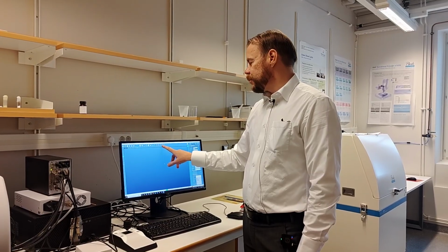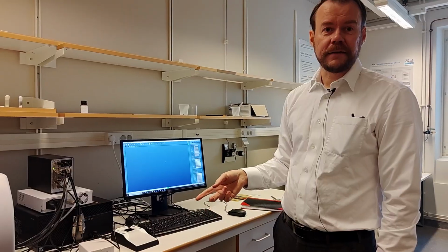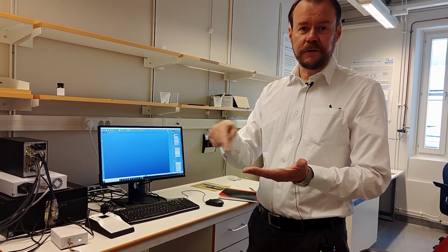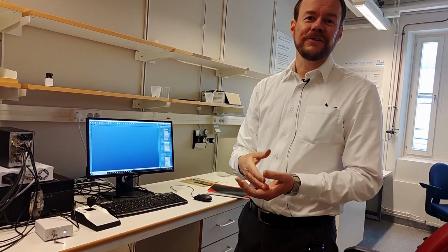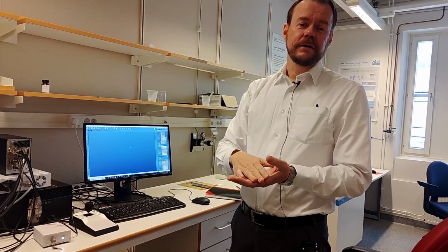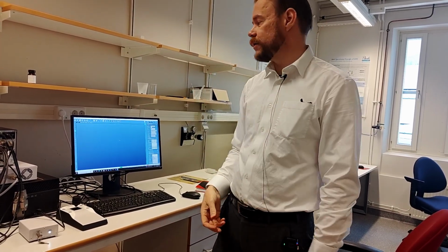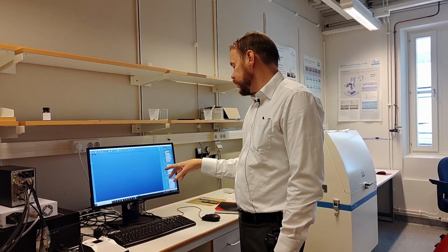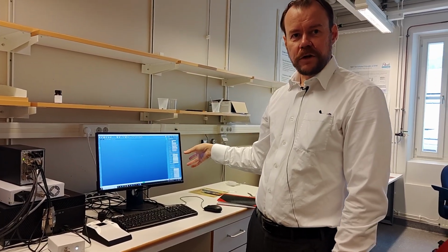And then there is this record button with that kind of matrix, and that is when you do mappings. So a mapping is when you want to get Raman spectra as a function of x and y position. You can take like 10 by 10 points, or as many points as you want. And you can also do a depth profile and make a three-dimensional volume if you want to. So you can measure as a function of depth, as a function of x and y. Then you get that kind of 3D matrix. But in this calibration phase, step one is just to see, does the spectrometer work before we start the calibration.